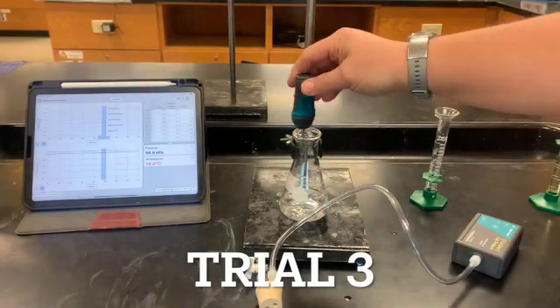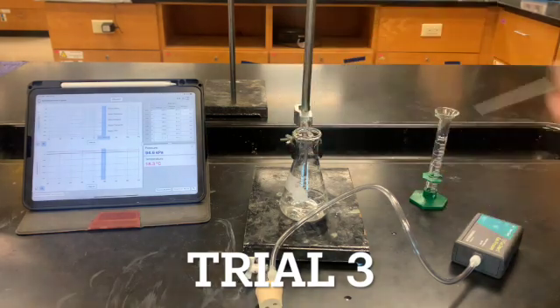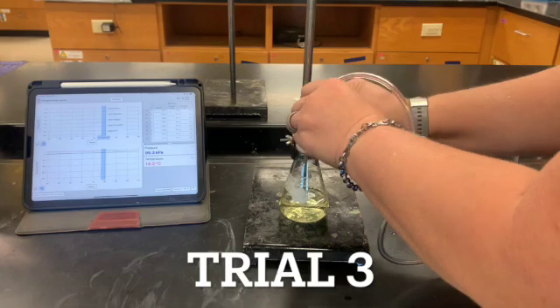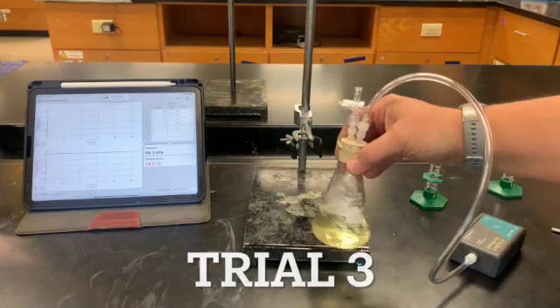And we'll get that starting temperature. And then once again, this time we have 10 milliliters of potassium iodide. Got our starting temperature. We're gonna pour it in there. We're gonna cap it. And we're gonna collect. And again, swirl.